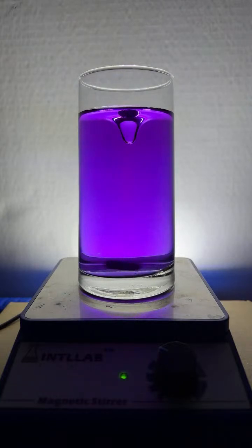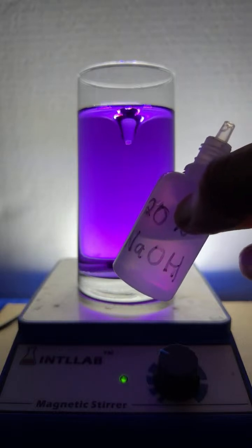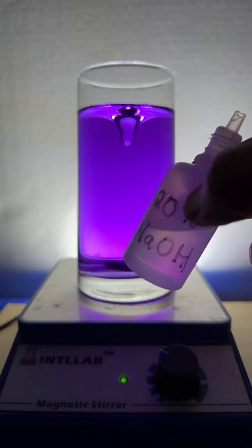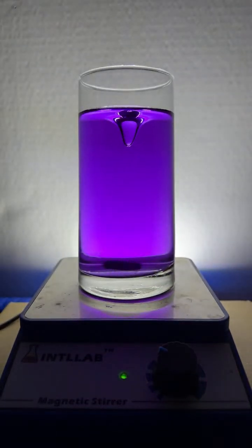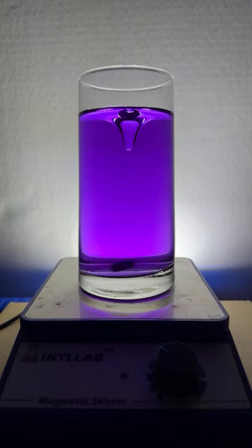it is household items, but I'm using 20% by weight sodium hydroxide, which I actually end up purchasing in the plumbing section. So it's like a drain cleaner. And then I also buy some 20% hydrochloric acid. It's also known as muriatic acid. I pick both these up at hardware stores. But if you're using this stuff, you got to really be careful.